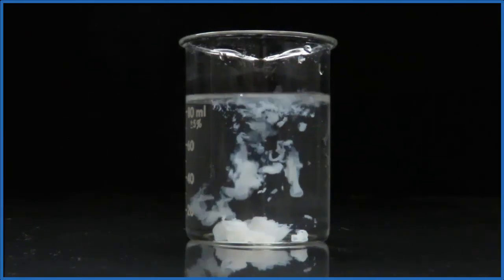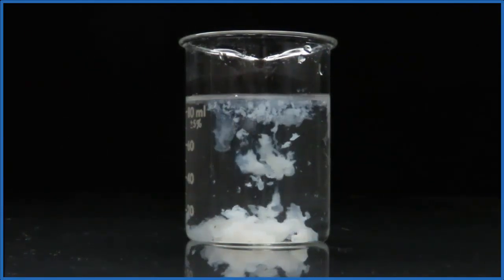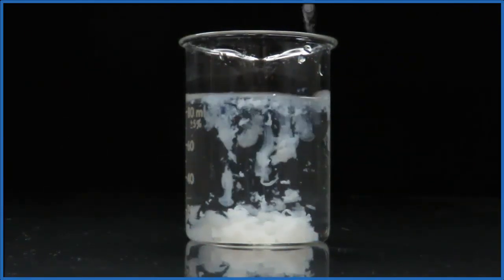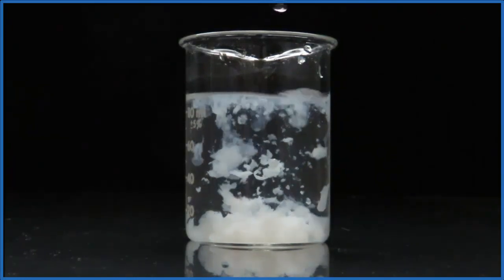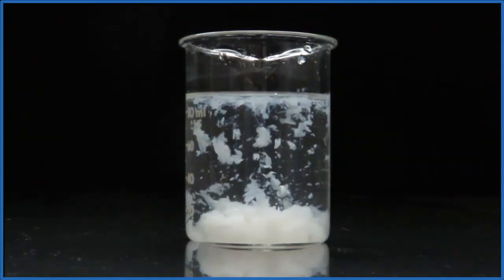I always find it fascinating when you have two clear liquids, two different solutions, and you mix them together and they form a solid. And that solid falls to the bottom of the test tube. It's called a precipitate.